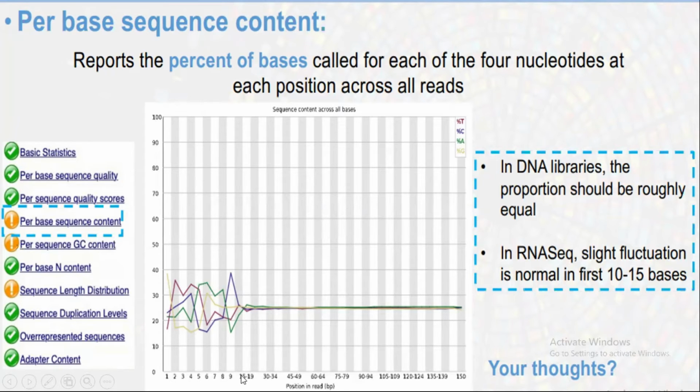Up to the 9th, or we can say up to the 12th base, the numbers are not equal, and I will show you what is basically the reason behind it. I also discuss it in part 4 and part 5 of this video series, but I will also tell you here. So here the number of bases is not equal, although after the 15th base of the sequencing read, now all the bases are equal. Okay, so this shows the per base sequence content. Why is 1 to 9 basically not equal?